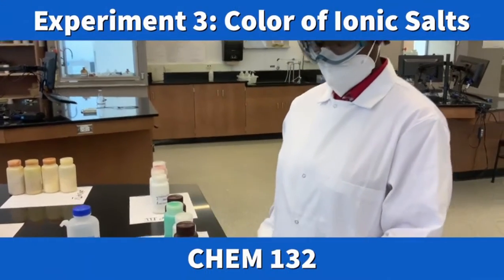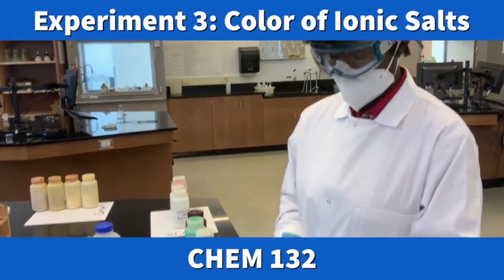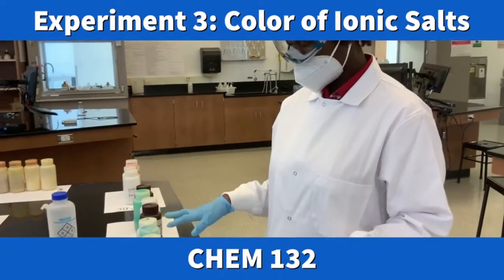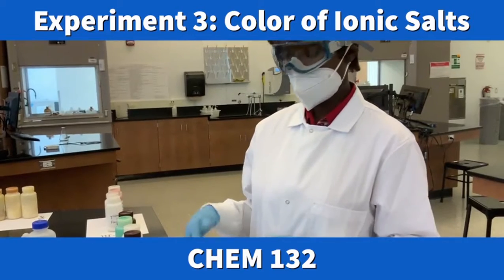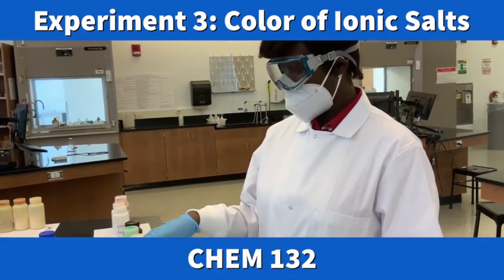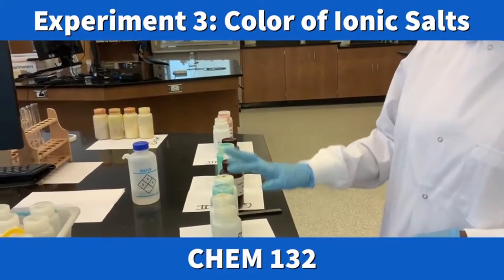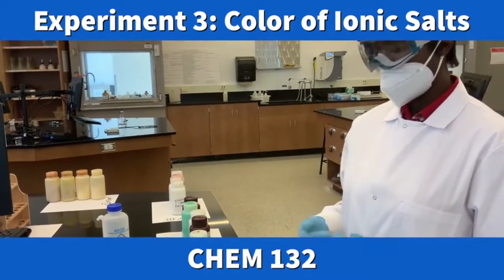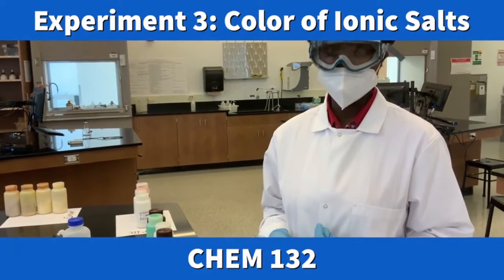We are on experiment 3, and in this experiment, the first part is the color of ionic salts. In this experiment for part A, our aim is to determine whether an anion or a cation determines the color of a compound. So you have 4 different groups of compounds, and 2 of them will be colored and 2 of them will be colorless. And so the first part, we just need to visualize the salt in water to see whether they give color or not, okay?